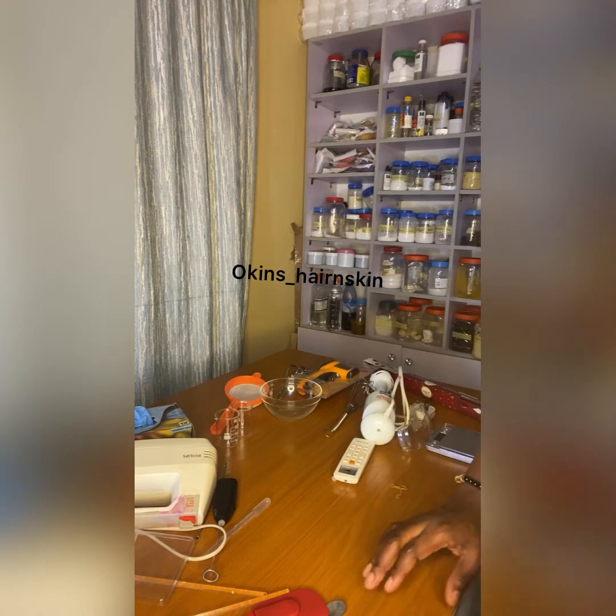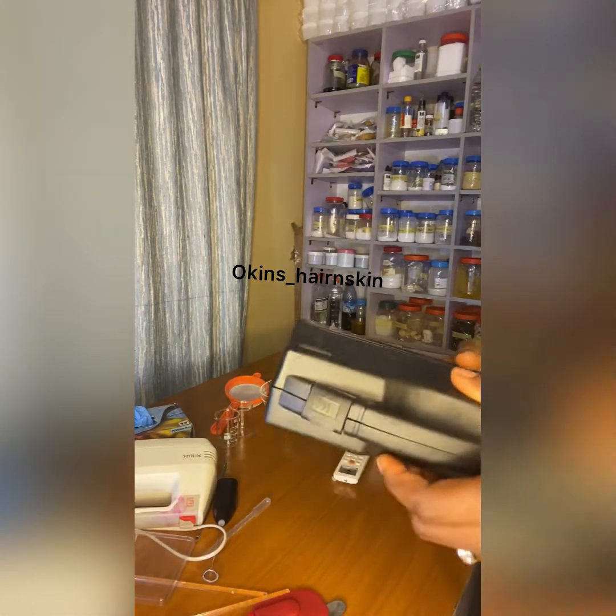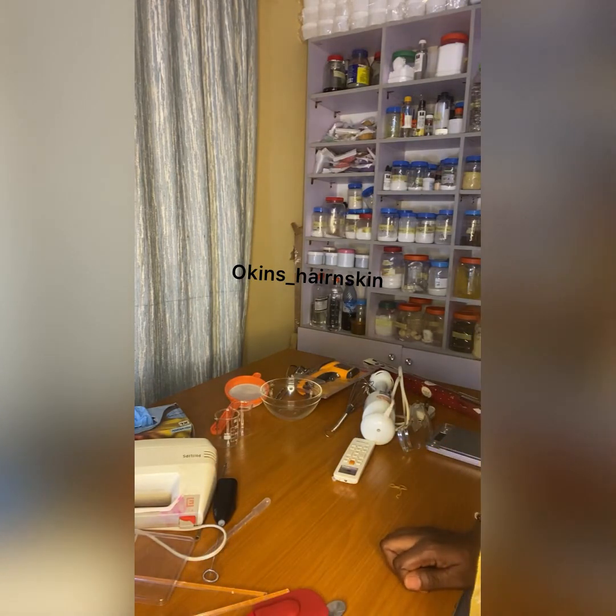When you want to start formulating, the first thing you have to put in mind is the pH meter. You really need it. You can't say, okay, later on I will buy. No, any product you formulate, you have to check the pH.